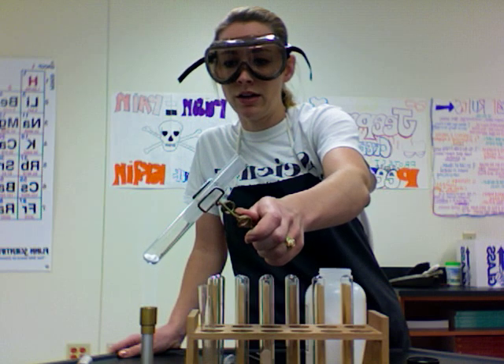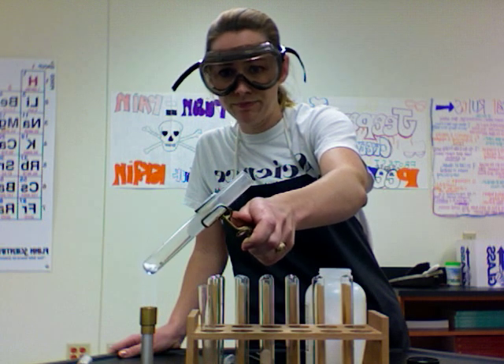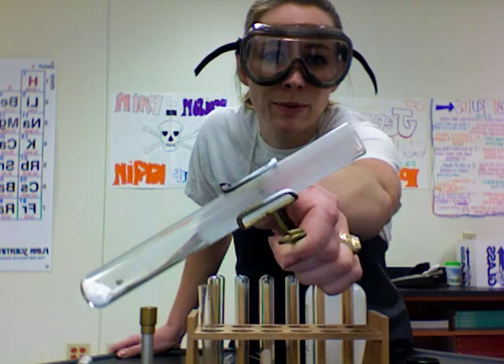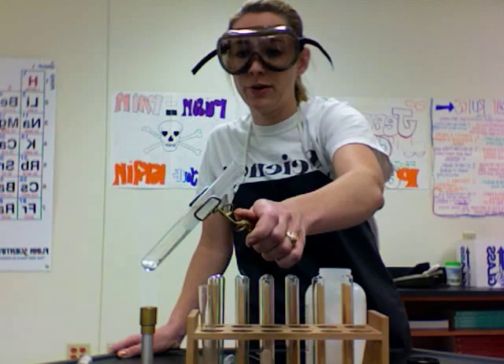The other product that we're going to get off is another gas — carbon dioxide — and we'll test for that. You can also see water vapor collecting on the inside of the test tube, because that is our third product: water.